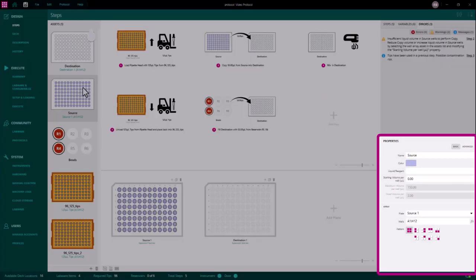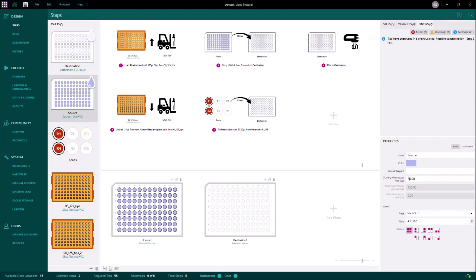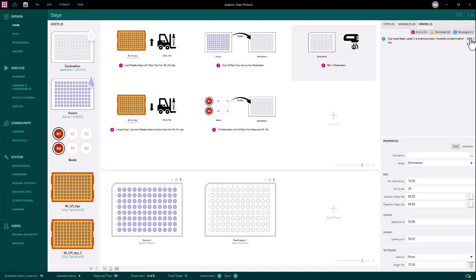We can see that the starting volume per well property is currently set to 0. Let's adjust this to 50 microliters per well. We can see this resolves our warning. Finally, let's look at the blue messages. This message is telling the user that these tips have already been used before this step, and that this may cause a contamination issue. In this case, this is not a concern, as the tips were used to transfer the liquid that is now being mixed. We can leave this without an additional tip change.